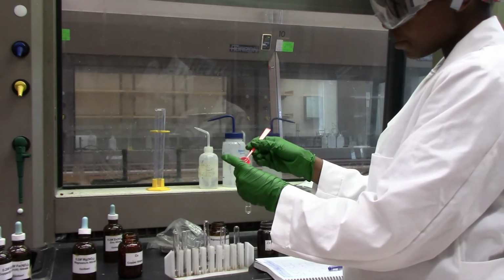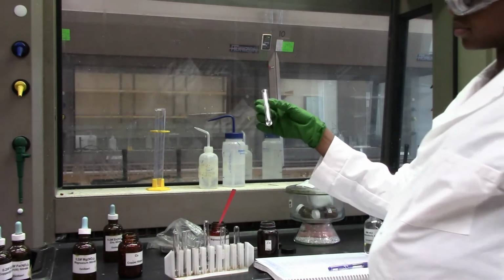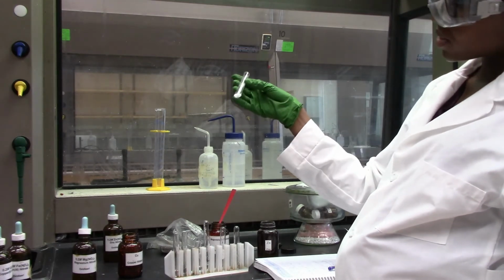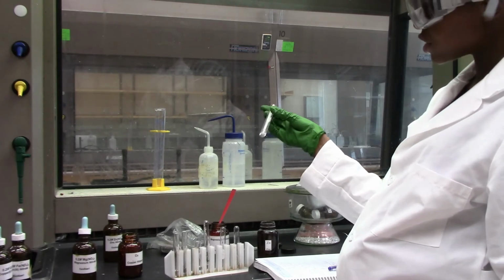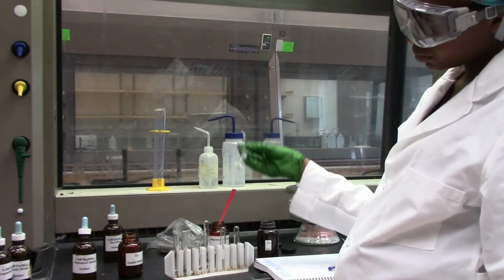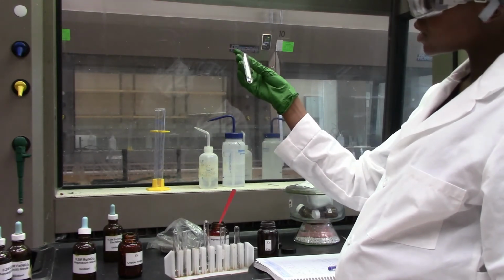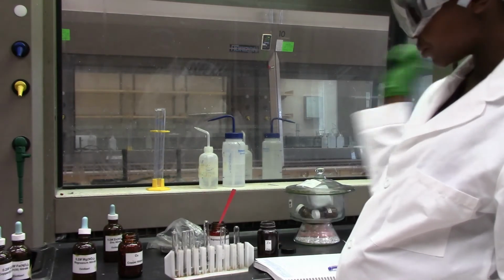So magnesium metal in magnesium solution. I would say, of course, magnesium will not displace magnesium, so it's just sitting in solution like the magnesium ion. So here we don't see any reaction, no color changes in solution.